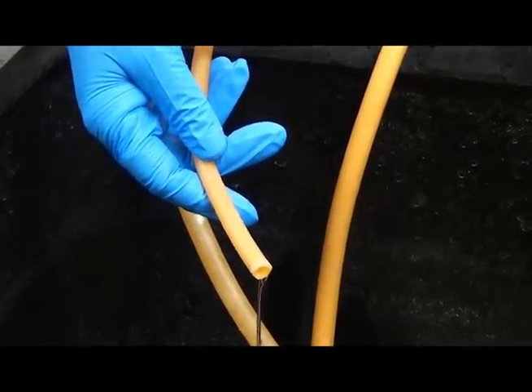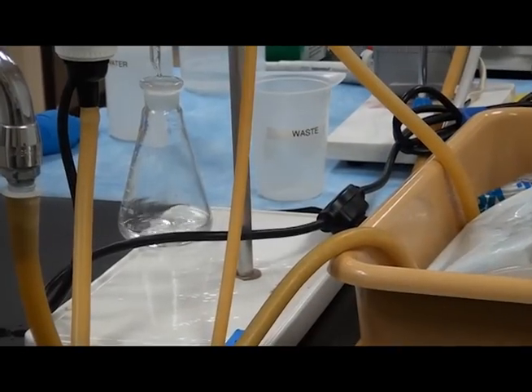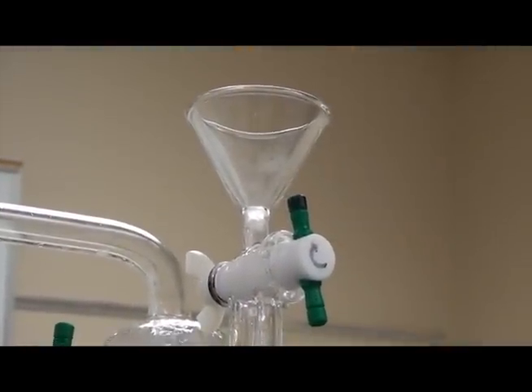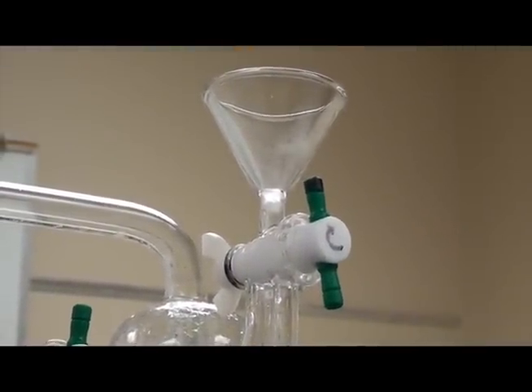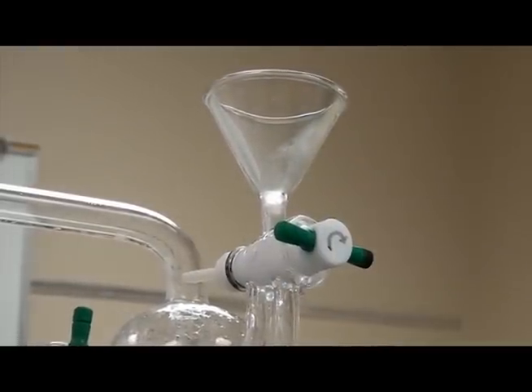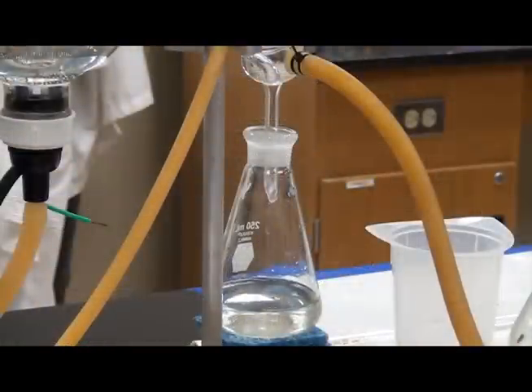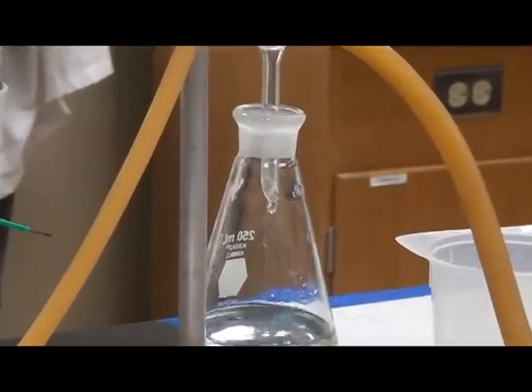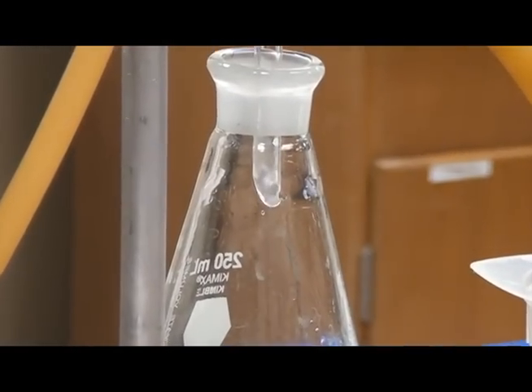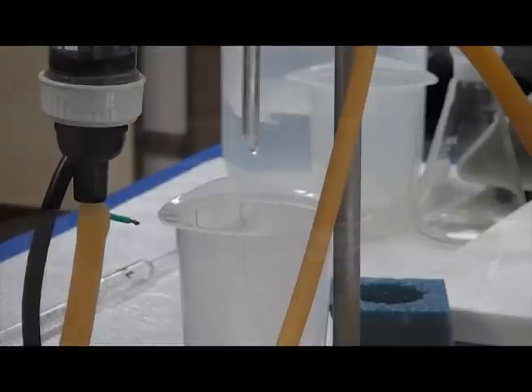Make sure the condenser has good water flow and is cool, and turn on the power. Be sure to have a labeled flask placed under the condenser drain to capture the sample. Wait until you see steam come out of the funnel, and then turn the knob horizontal. Add DI water to the funnel to ensure that you have a closed system. The sample size collected should be 100 mLs. When the flask has this much distillate, turn off the power and remove the flask from under the condenser, and replace with a waste container to catch any remaining distillate.